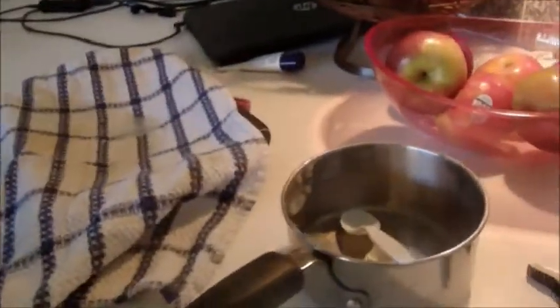Hey YouTube, I am back. My potassium nitrate is here. I'm going to dry it. It does help if you have a spoon with you, so I'll be getting a spoon. I could just scrape the pieces out. Here I have a lot of it. I'll put down the camera so you can see a bit better. This is what it looks like from the inside. I'll be back when I get it all in there and dried.